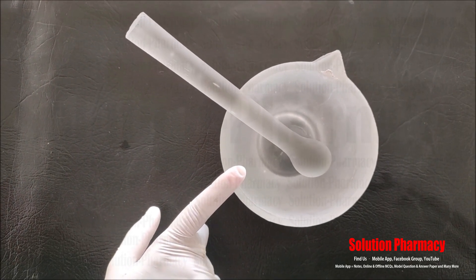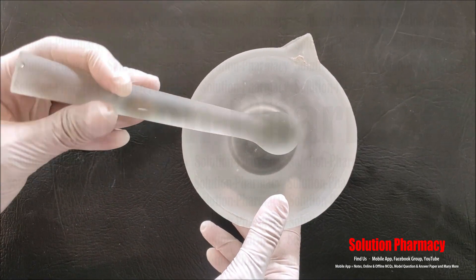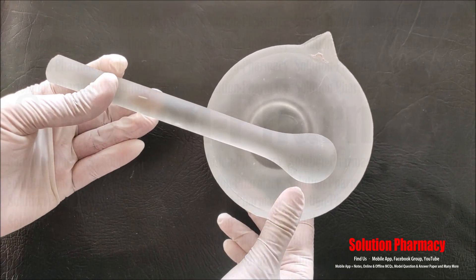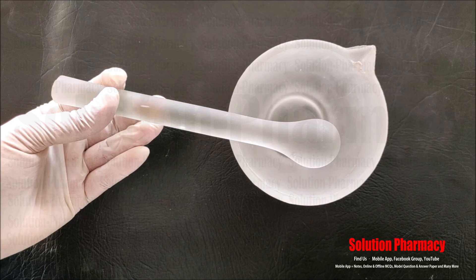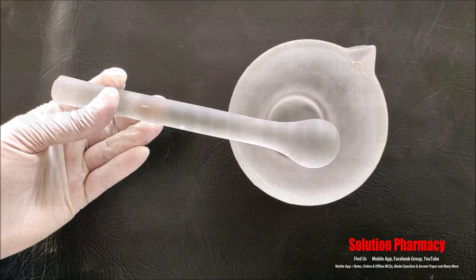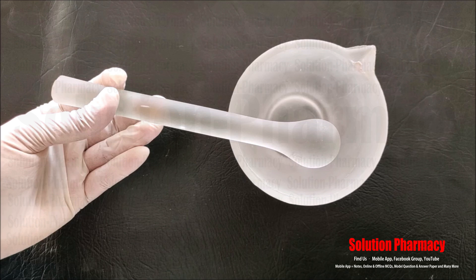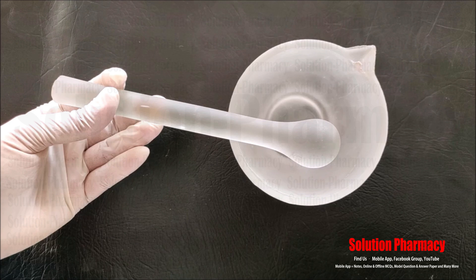Next, this glassware is called a mortar and pestle — this is the glass mortar and pestle. This is called the mortar and this is called the pestle; we move the pestle over the mortar to prepare a mixture or break a substance into powder form, especially soft materials. This glass mortar and pestle is stain-resistant, used when a non-staining, non-porous surface is needed for grinding or mixture preparation. Since it is made of glass, it is used to grind soft materials to reduce their size, and is generally used to incorporate large amounts of liquid.